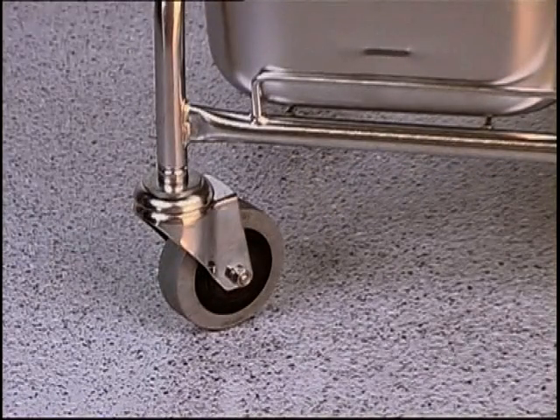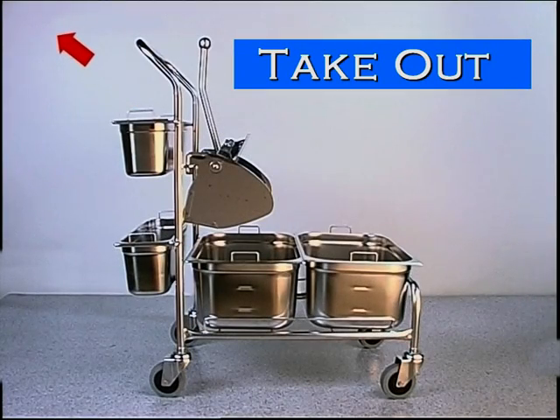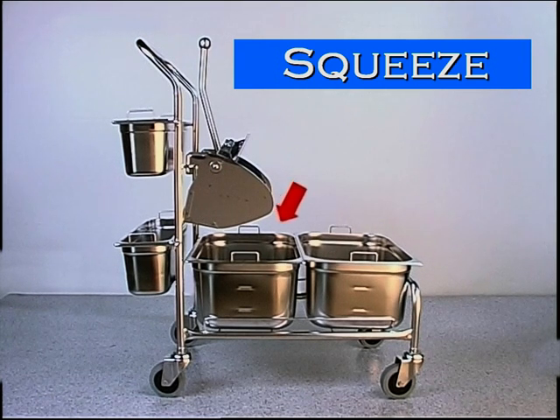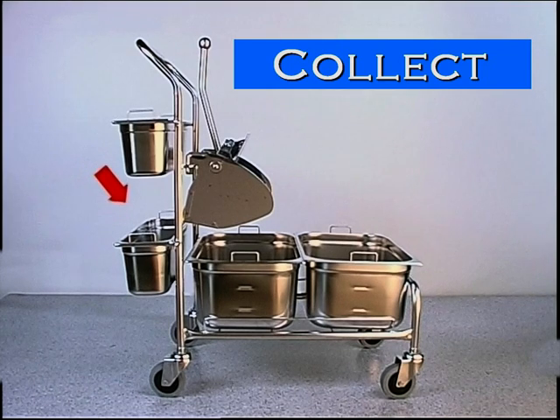This is the tub that the sterile mop covers are taken out of. The large tub is intended for the disinfection solution and is so wide that the mop can comfortably be immersed before being squeezed out in the mop press. The remaining liquid drops into the special drip tub to prevent contamination of the cleaning solution. After wiping, the used mop covers are dropped into this tub.